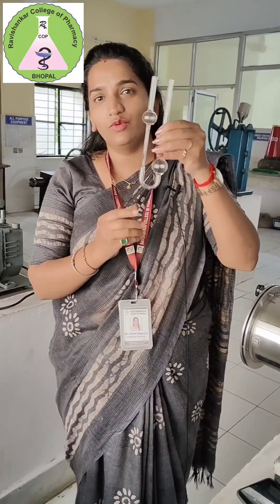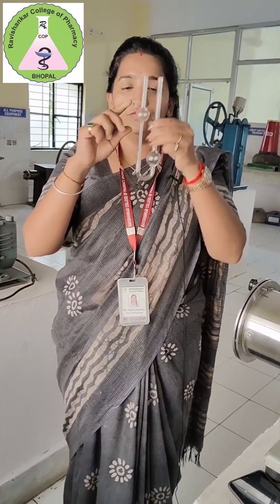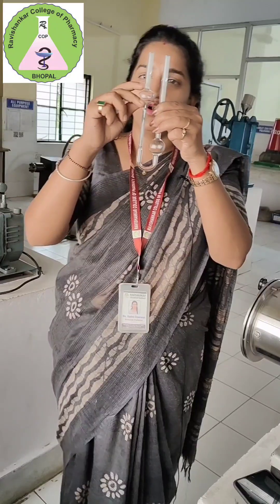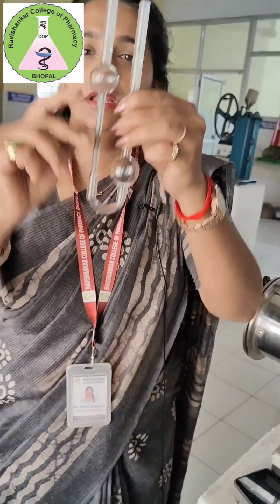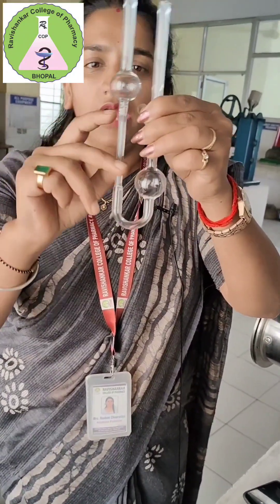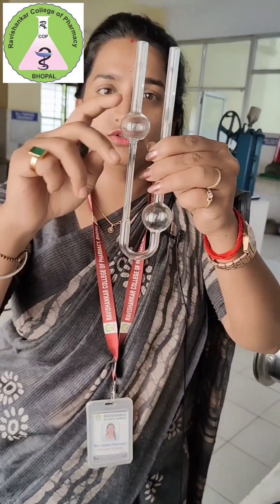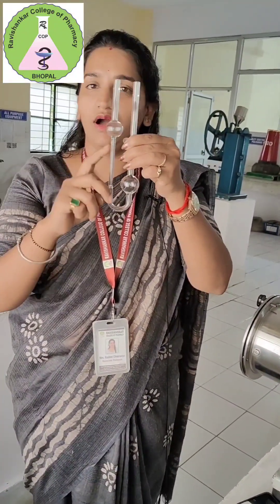Firstly, we have to place this Ostwald viscometer in the vertical standing position. Then fill the liquid in the lower bulb and suck the liquid into the upper one. The time required to fall from the upper mark to the lower mark is noted. The upper bulb consists of two marks — one on the upper side and one on the lower side — and we determine the time for liquid to flow between these two marks.